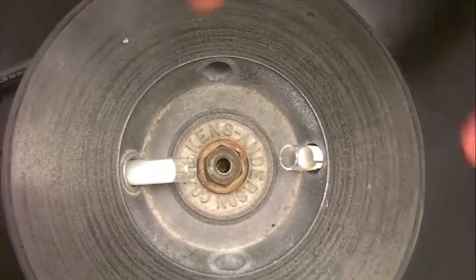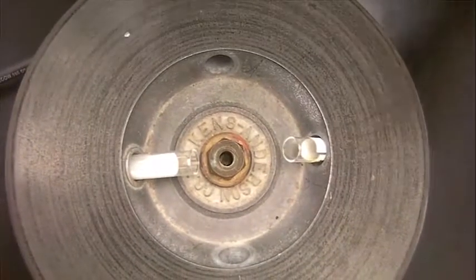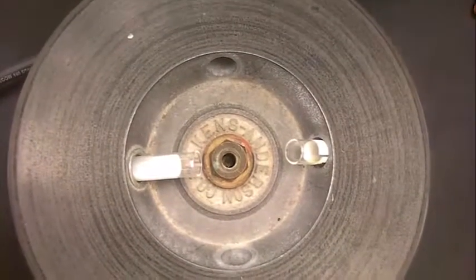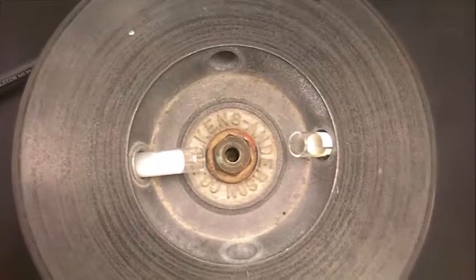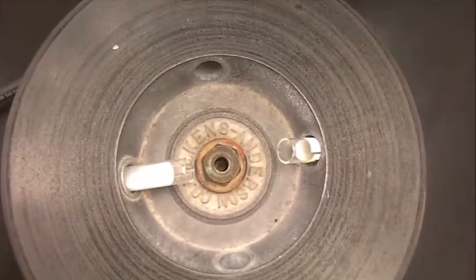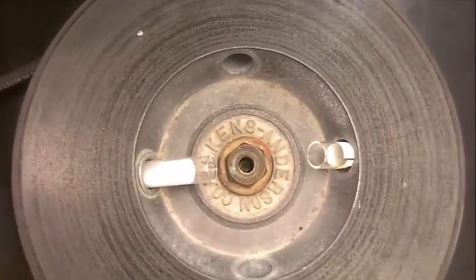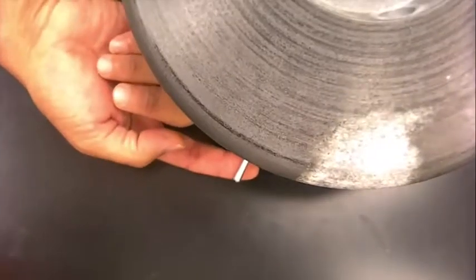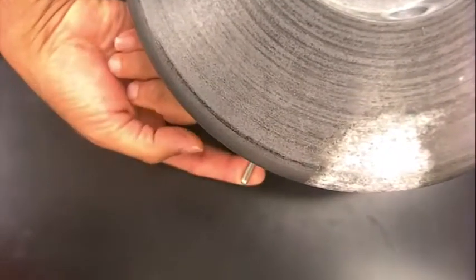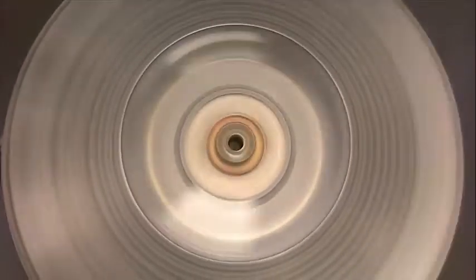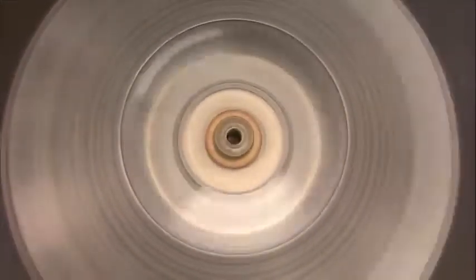If they don't balance, your test tubes and the material inside the test tube will actually fly out, and it could be a very serious hazard. There's going to be a switch right here. You flip that switch. And the precipitate will collect. This may be very loud, but that's okay. You want to do this for about one minute.